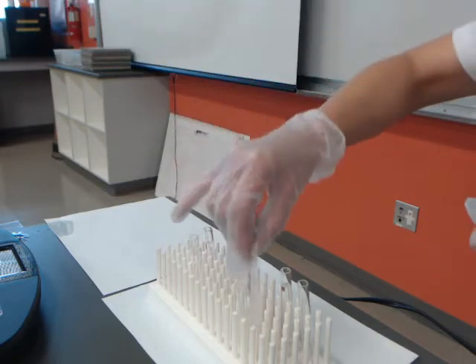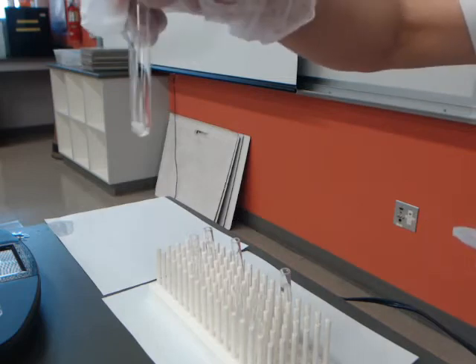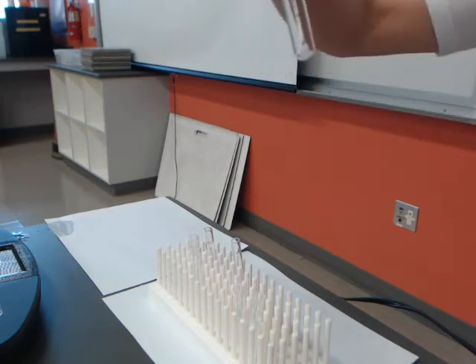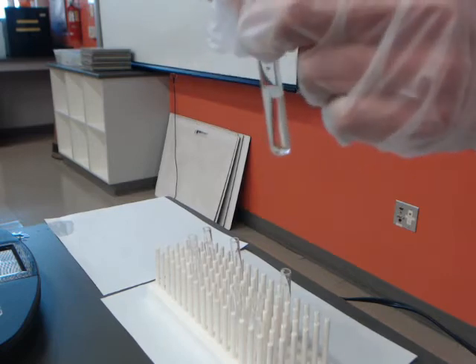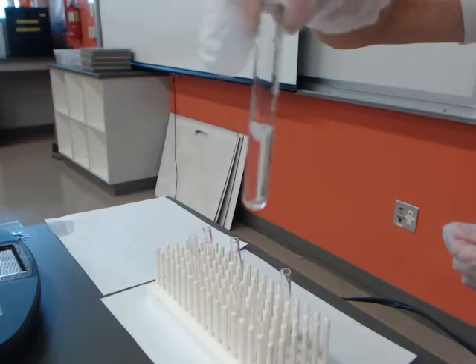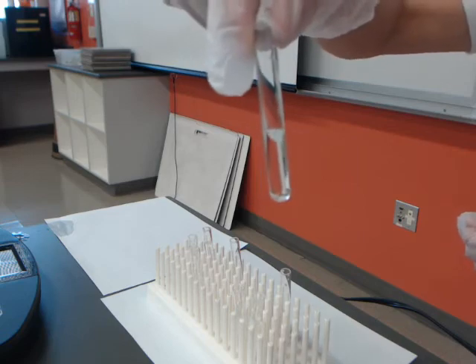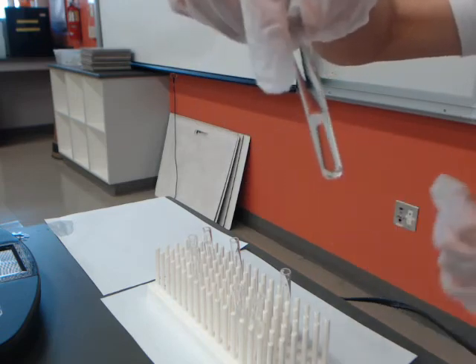Test number 2. Test number 2 has got wax. So we've got a piece of wax in this small test tube, and then we're going to put some liquid water in with the wax. And so you'll notice that the wax is now kind of floating on top of the water. They don't appear to be mixing. Okay. If I tap it, try to mix it, it stays the same.